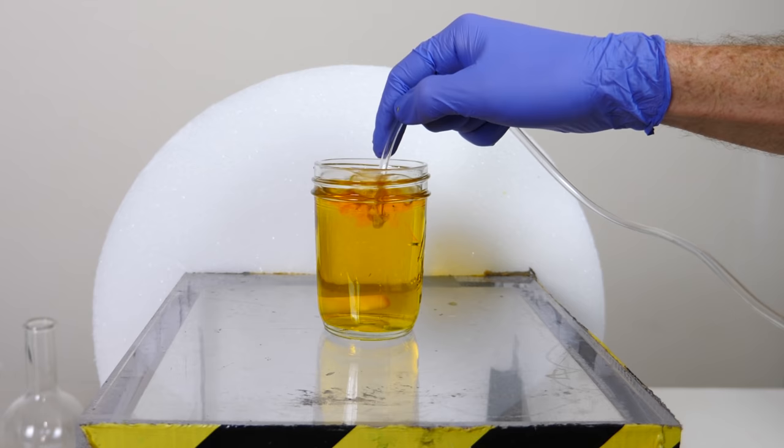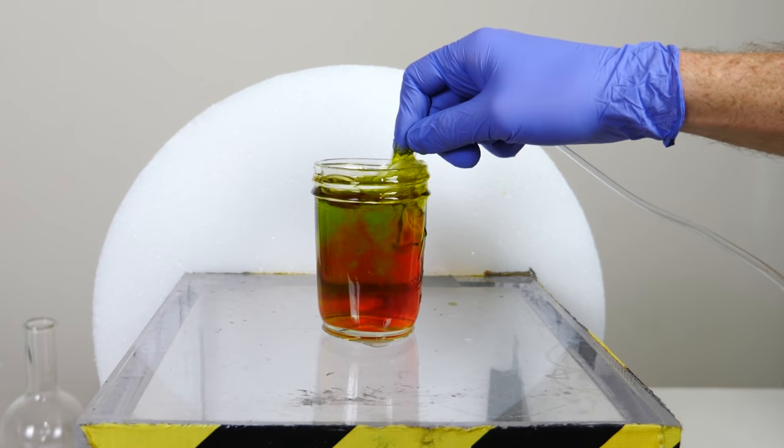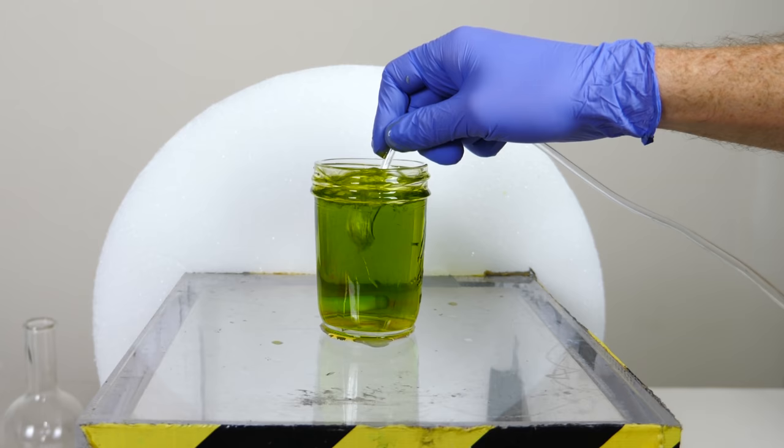Quickly turns red. And then green. That is so cool.